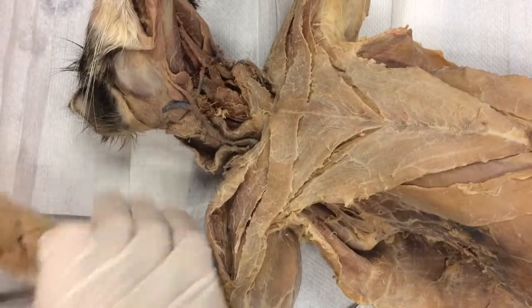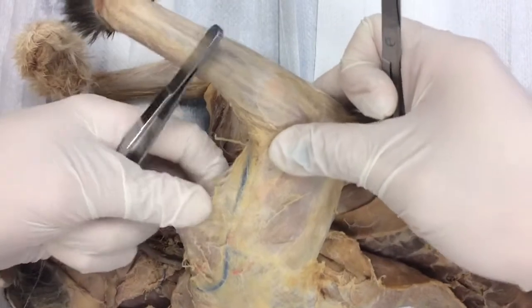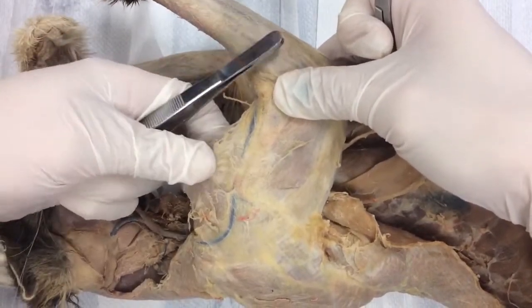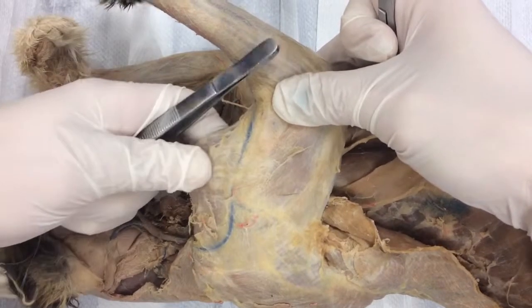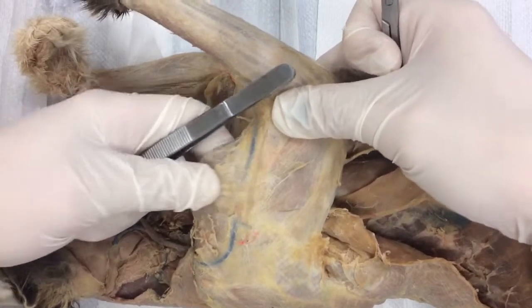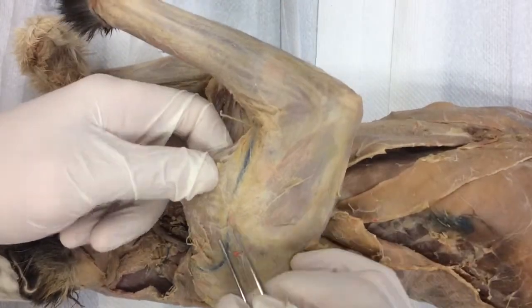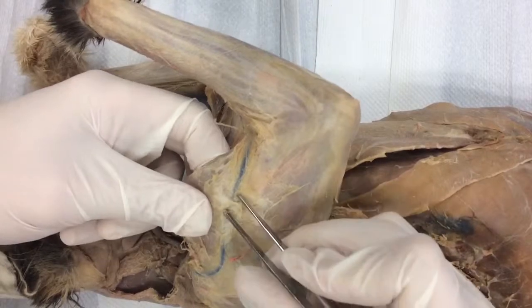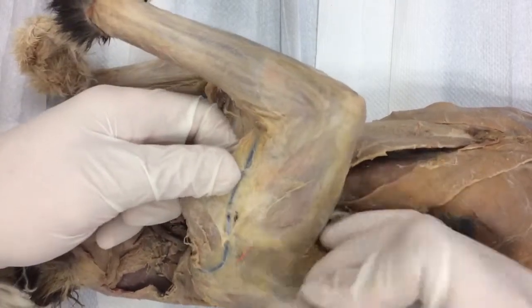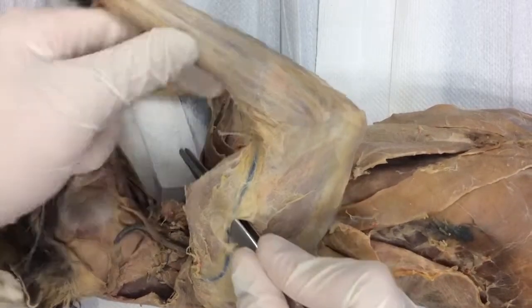What I'm trying to do — I hope I can show this to you. What I'm trying to do is get to the other side on the arm. Now there's a lot of connective tissue here, but watch. See where that thing's buckling? Can you see that buckle? That's where you want to dissect. Some of you are going to have this big blue vein — I'm not worried about that. And look, just by pulling that connective tissue, look what happened. I'm through.